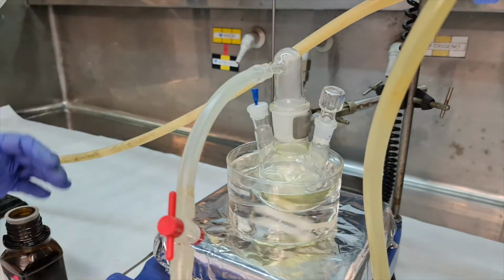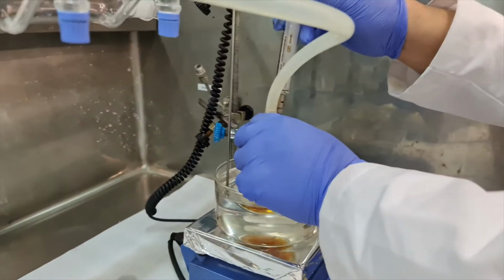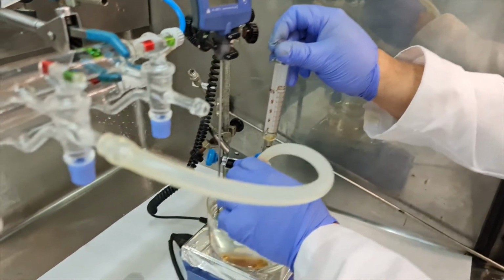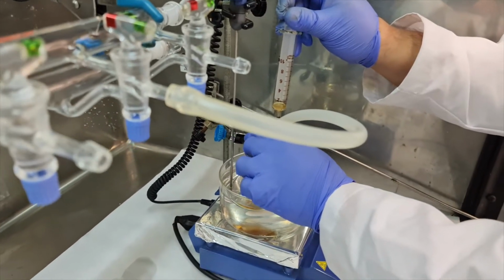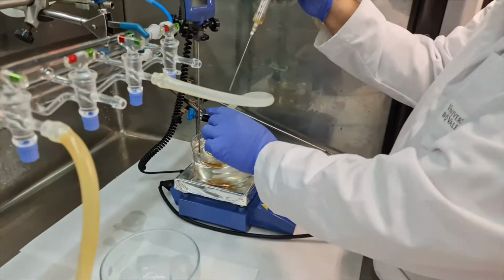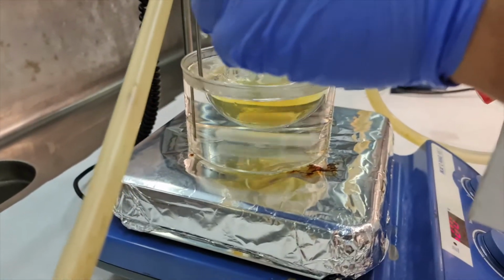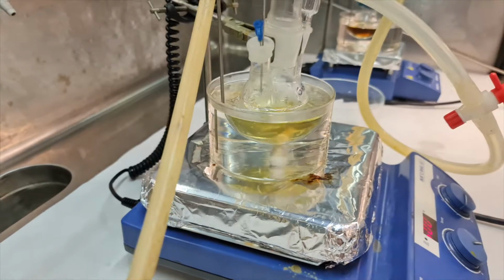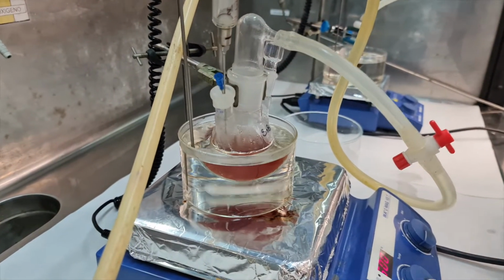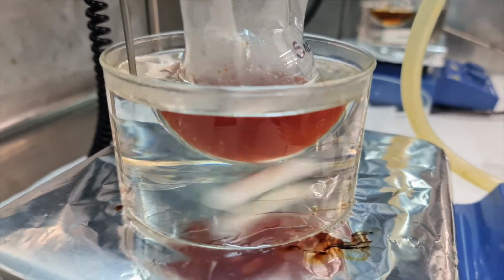The metathesis reaction between tin halide and cesium oleate gives rise to the formation of cesium-tin halide perovskite nanocrystals, observed as a color change in the precursor solution to red in the case of cesium-tin bromide perovskites and red-brownish for cesium-tin iodide nanocrystals. When these nanocrystals were irradiated with laser excitation, we do not observe visible color emission because cesium-tin halide perovskite nanocrystals exhibit infrared light emission.